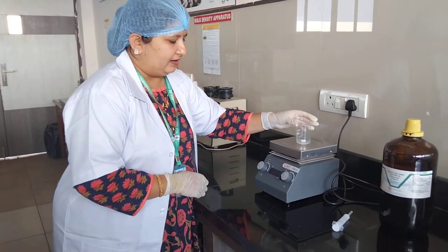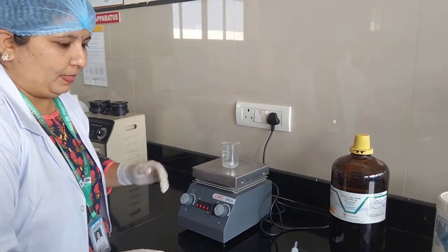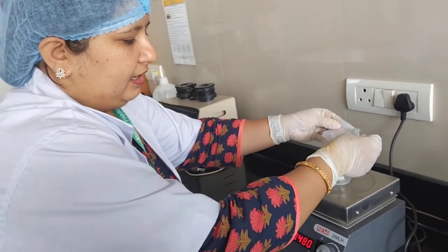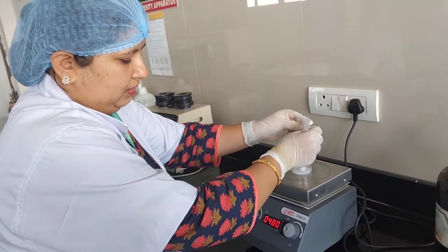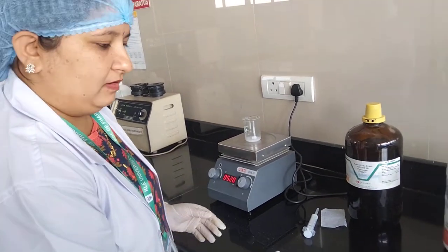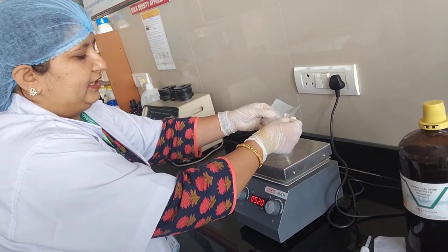I have set up the beaker and taken 10 ml of acetone. The weighed quantity of drug will be dissolved pinch by pinch in the acetone. The rotations are adjusted to 500 rotations per minute. After the drug, we will be adding HPMC polymer in smaller quantities with continuous stirring.